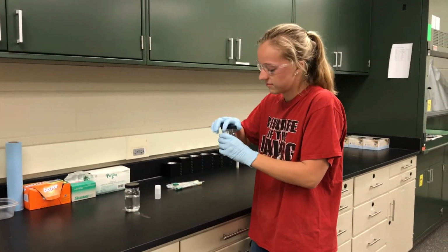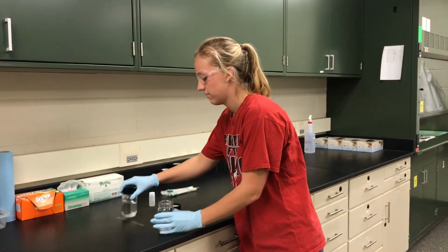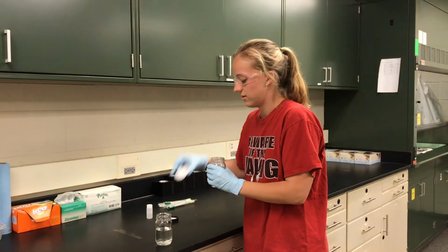Marianne has learned a lot about how to respond to emergency situations in the lab, but she still has one more lesson to learn.